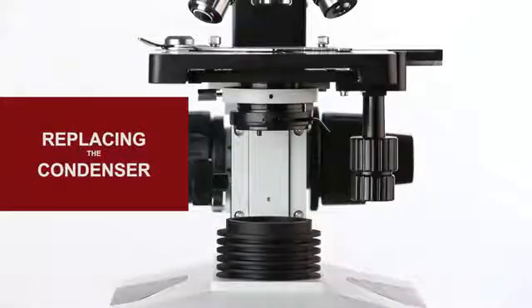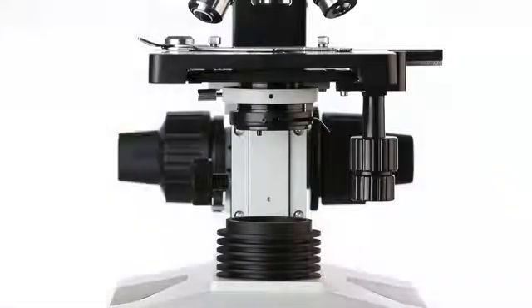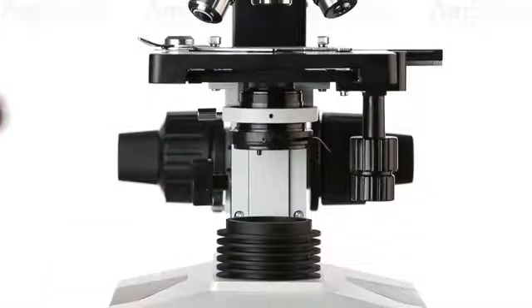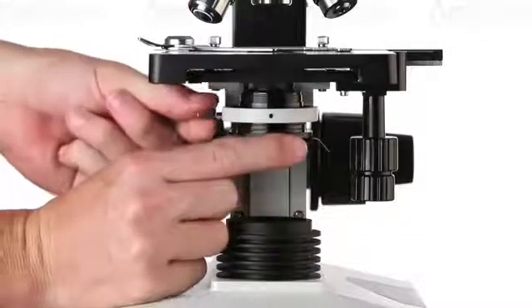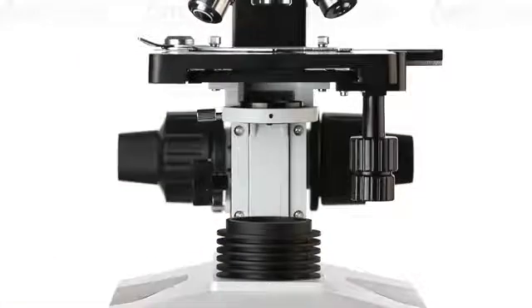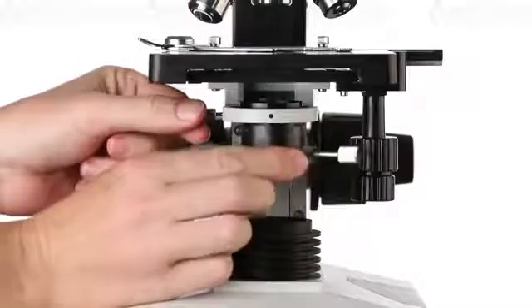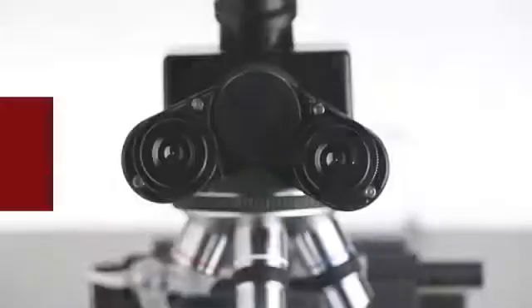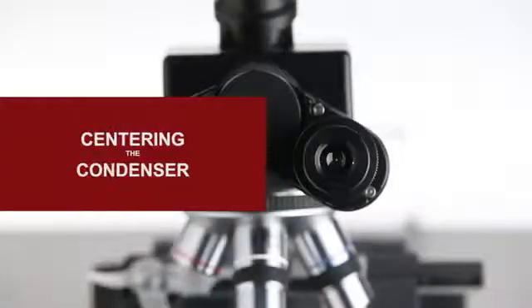Replacing the condenser is a simple process. The condenser can be raised or lowered by using the adjustment knob. While supporting the installed condenser, loosen the locking screw until the condenser can easily slip out. Next, insert the Darkfield condenser fully. Then securely tighten the locking screw. A Darkfield condenser should be centered for optimal results.